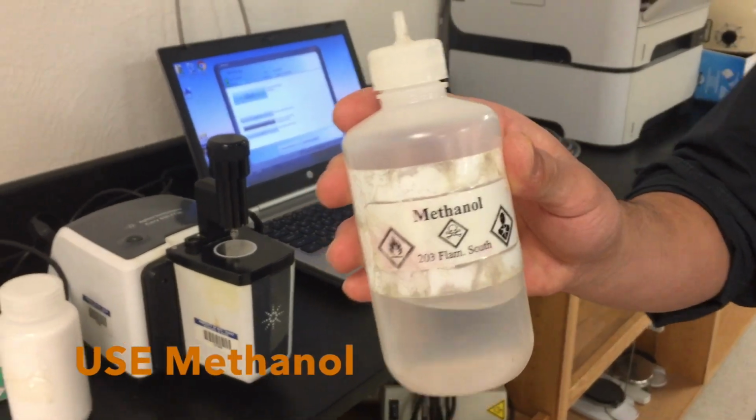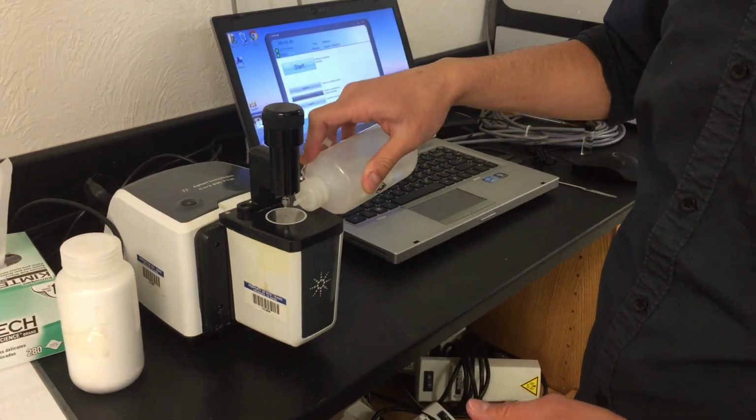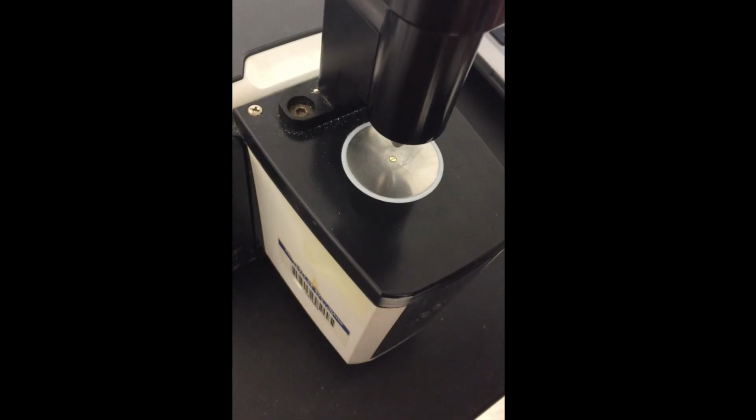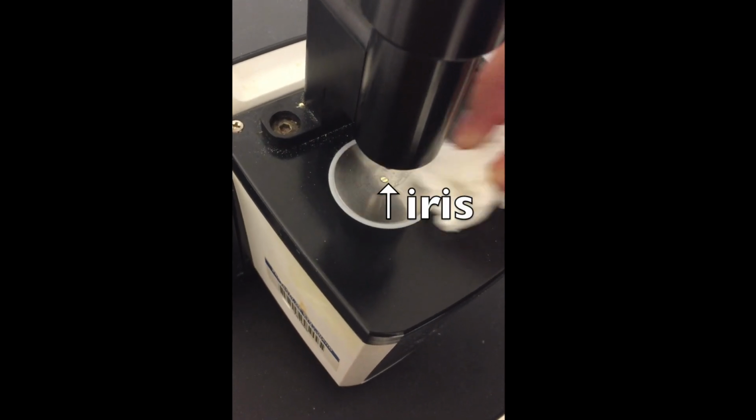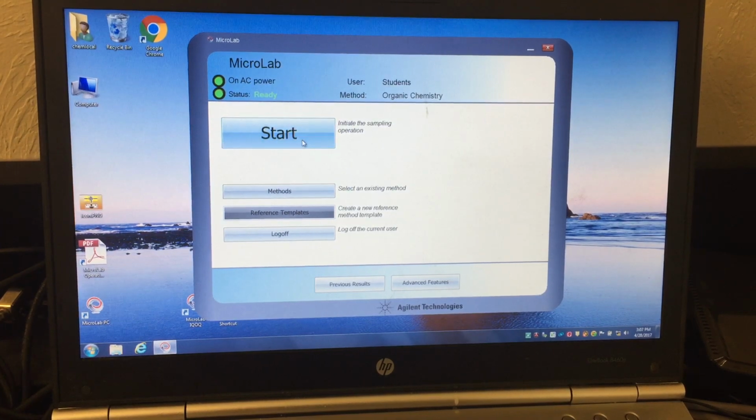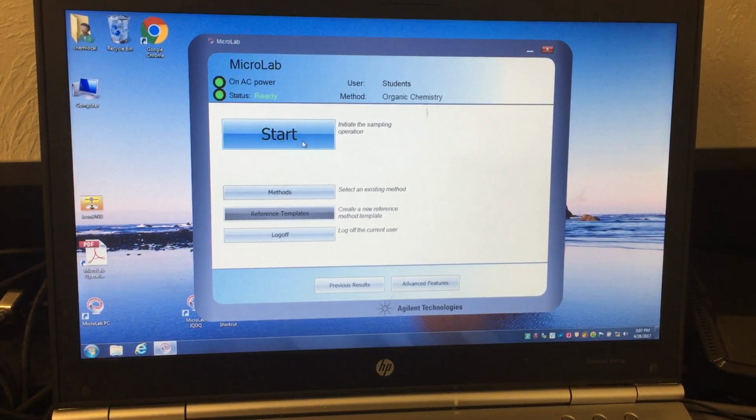When you clean the IR spectroscopy, apply some methanol and then use a Kim wipe to clean it up. Make sure you don't have any residue left on the iris. Before you place the sample, you need to check the noise line called background.